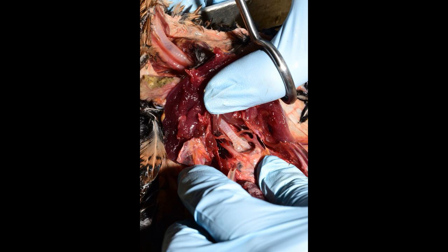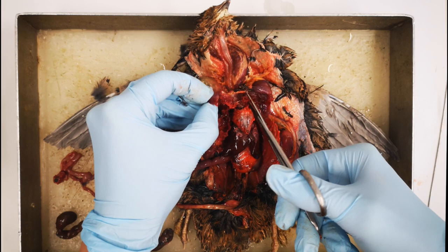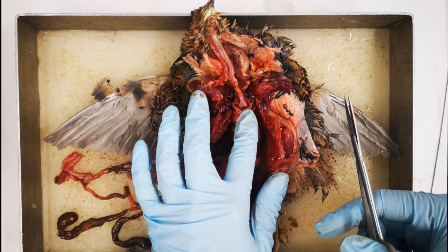In order to expose the heart, an incision is now made anteriorly on the remaining part of the sternum. The heart is now dissected out together with the trachea. To do this, the emerging vessels are carefully cut with scissors.